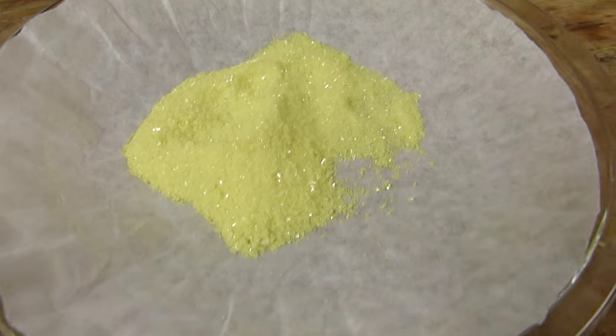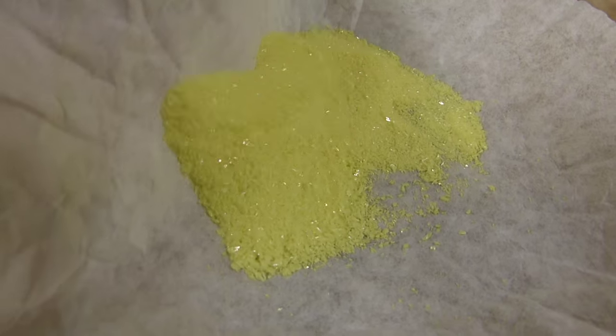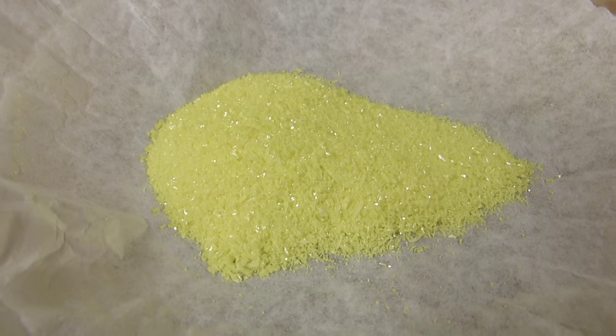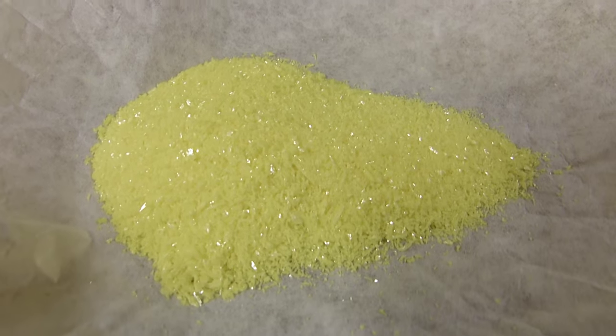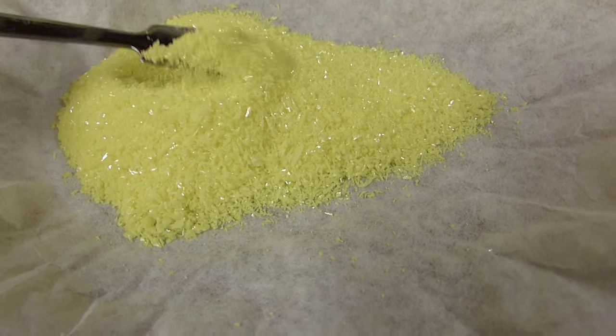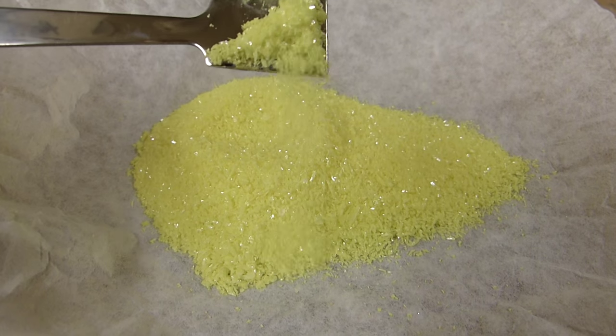Just pop that out. Teflon. Nothing sticks to it. And there we go. So that's freshly recrystallized sulfur.